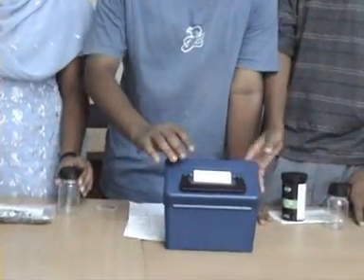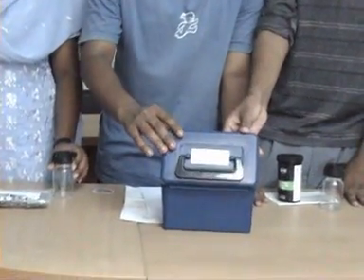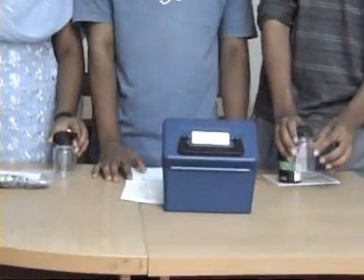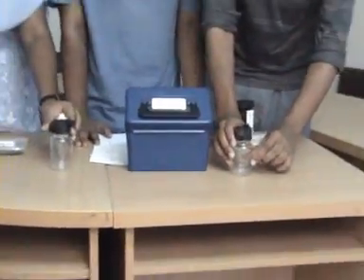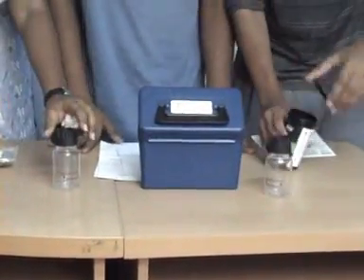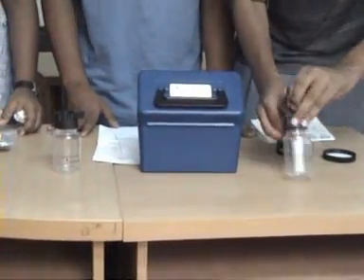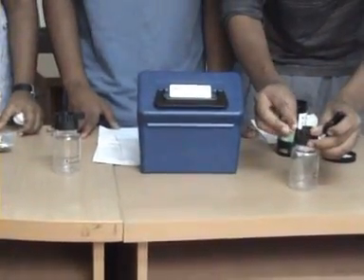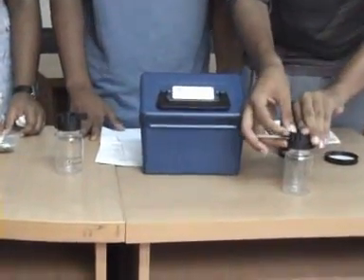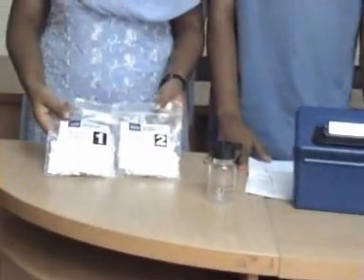To test arsenic, we used our Easy Test arsenic test kit. At first, we took 50 ml of water in each of these two bottles for the same test of each sample. Then we fixed two strips properly in the cork of the bottle. Then we added reagent 1 in the bottle and swirled a little.